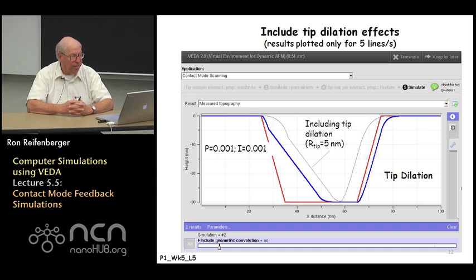So for the last slide in this particular lecture, I just turn on this geometric convolution effect. So I let the tip radius come into play. This is done to illustrate what a realistic image would look like. In this case, the solid blue line represents the case when the tip radius is 0, right? The solid blue line does roughly reproduce the topography that we specified. The topography we specified is the red curve.